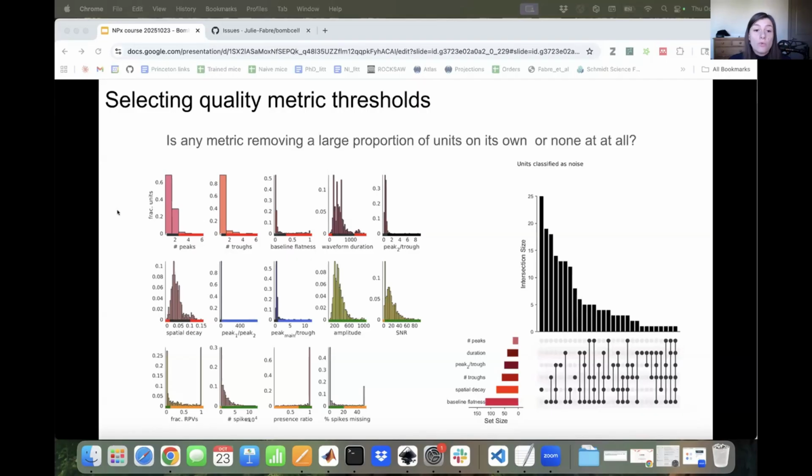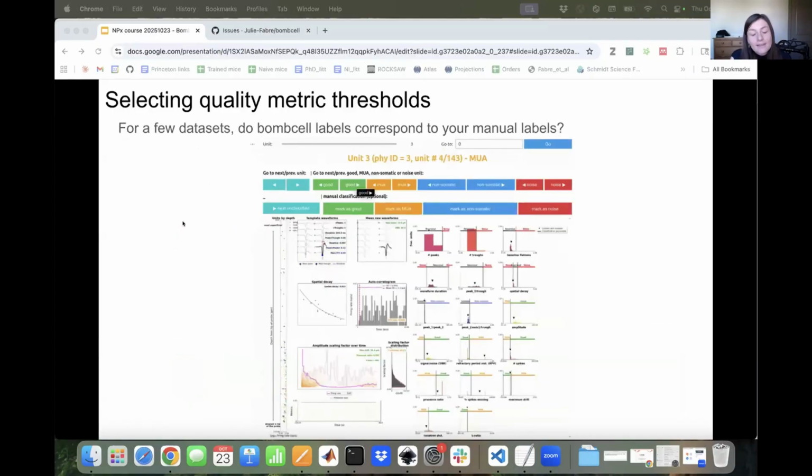Also with the distribution plots showing you what are the distribution of quality metric values for your units and how are they actually classifying your units into the 4 different categories. This is just a very quick assessment, like for the waveforms, are any quality metrics removing far too many or none at all? This would be an indication that you should look more closely at these metrics and perhaps fine-tune them. And then the best way to actually fine-tune, I think, is really for a few data sets, flip through all the units with the quality metric GUI and actually assess whether Bombcell labels correspond to your manual labels. So you can add manual labels, and then you can automatically compare the manual labels to Bombcell's classification. And Bombcell will suggest which thresholds you can potentially adjust to see if it actually matches what you believe.